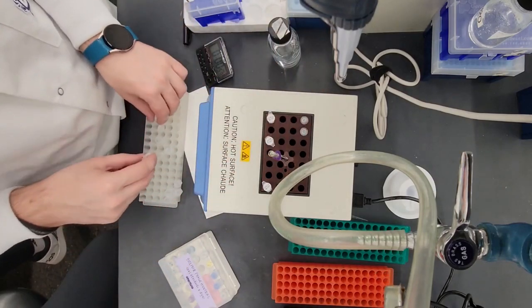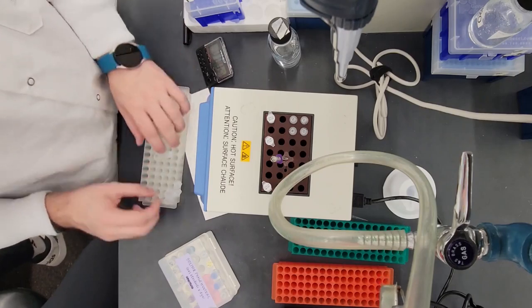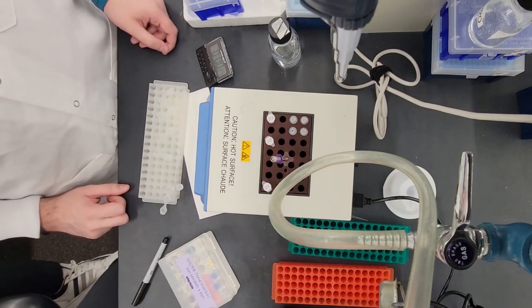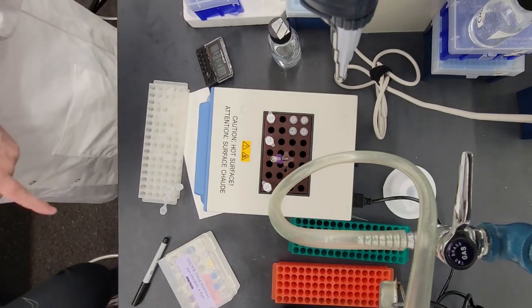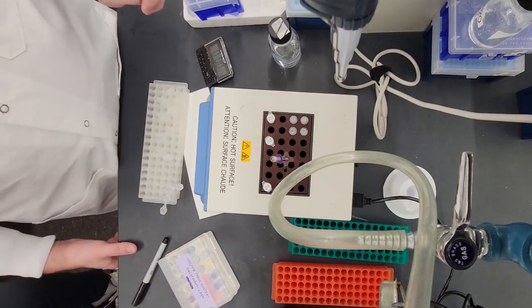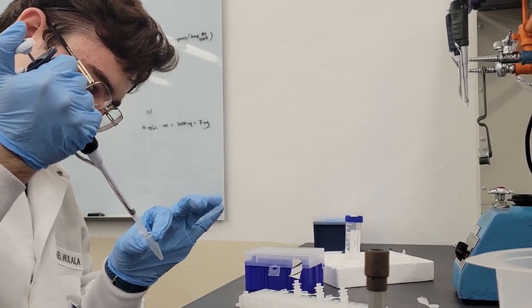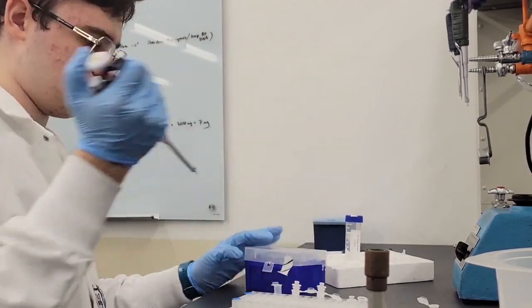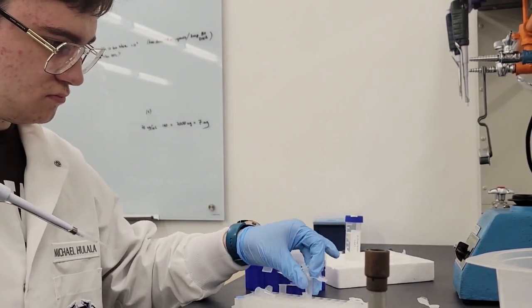So you're done filtering it out. Now what? Well, we actually got to spin it a few times to make sure there isn't any isopropyl alcohol stuck inside the chamber. And once that's done, we're going to heat it up in a little heating block. This is basically just a fancy machine that heats stuff up. There's nothing more to it. Although we got to make sure we don't hold in there for too long, because this is actually going to break the bonds between the beads and the nucleotides, but we don't want them to actually break the bonds in the DNA. So if you hold there for maybe more than a minute, your DNA is going to start denaturing. So we're going to quickly pull it out and we're going to pipe hot water through there, which is going to flush out all the DNA, because it's actually not going to break the bonds between the beads and the actual chamber, but it will actually just clean up all the DNA nice through the little hole at the end, which will put it into the microcentrifuge tube and boom, you have pure phage DNA.